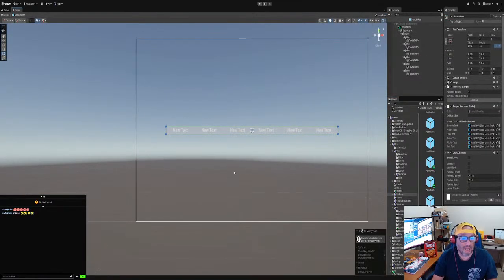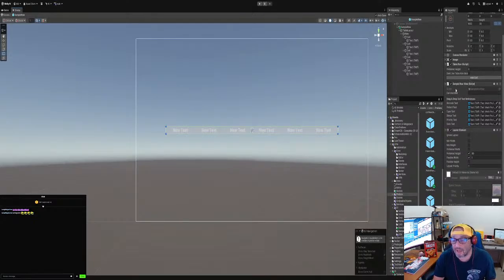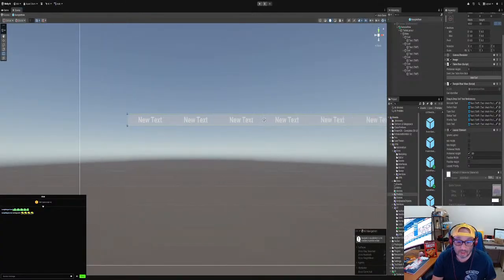Then we attach a script to it. You can name it whatever you want, but I attached a script called SampleRowView. Let's just open that up so you guys can see it. For the first part of this stream, we are just going to work on the UI first, just to get you guys caught up. Then I'll open up that script for you.